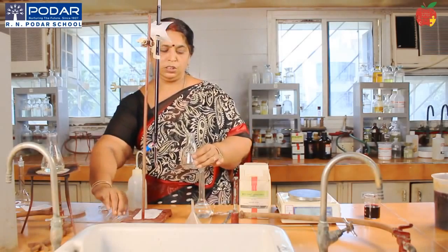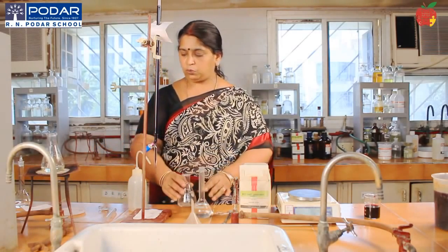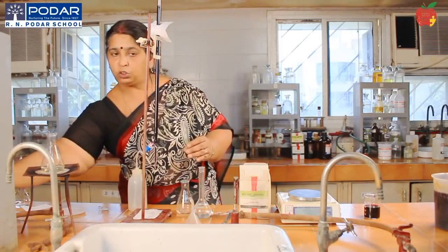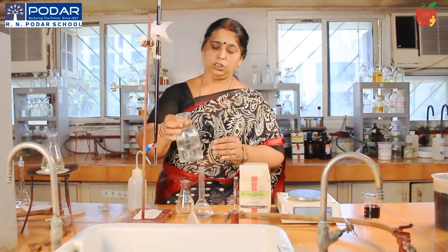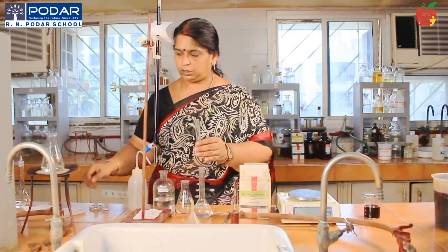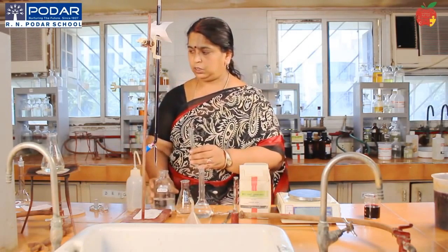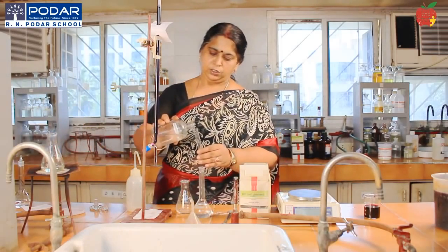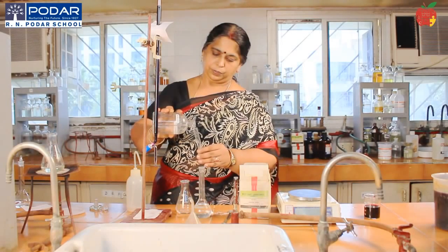Now don't forget to add one test tube of dilute sulfuric acid to make the medium acidic. Okay, so add dilute sulfuric acid. Add the dilute sulfuric acid to this.